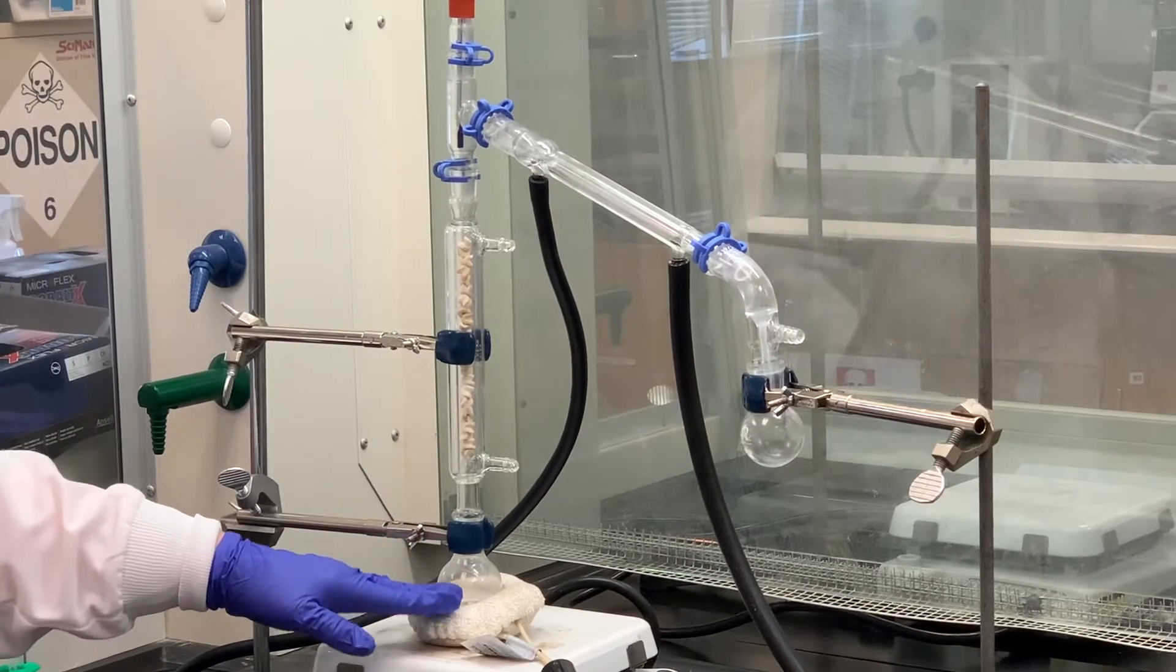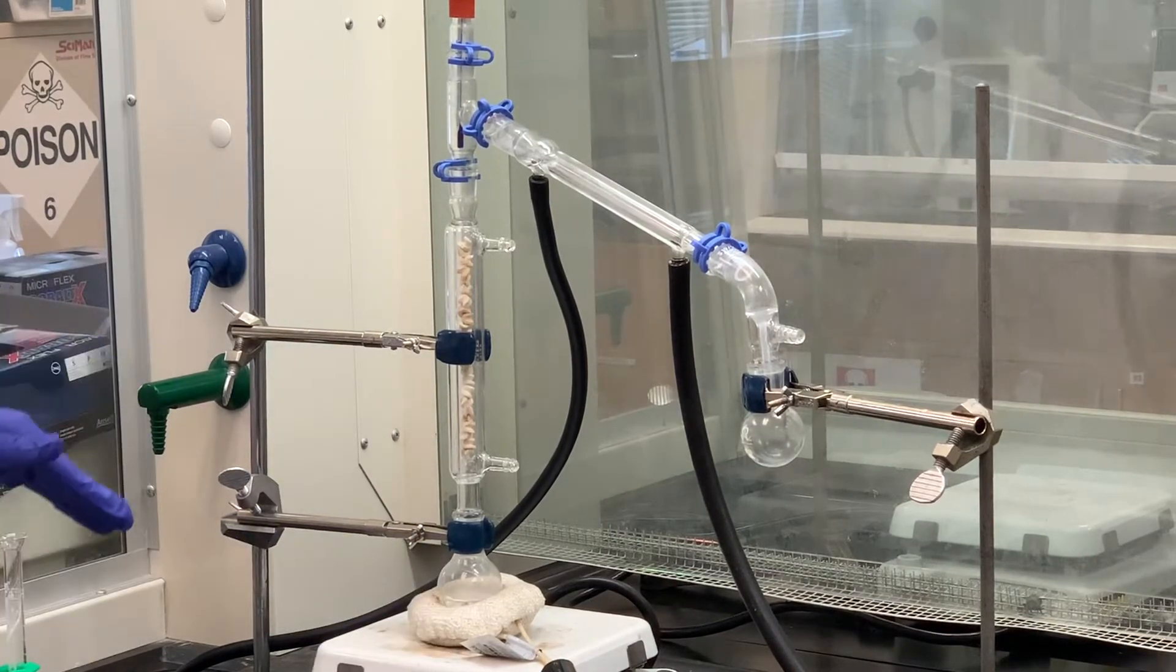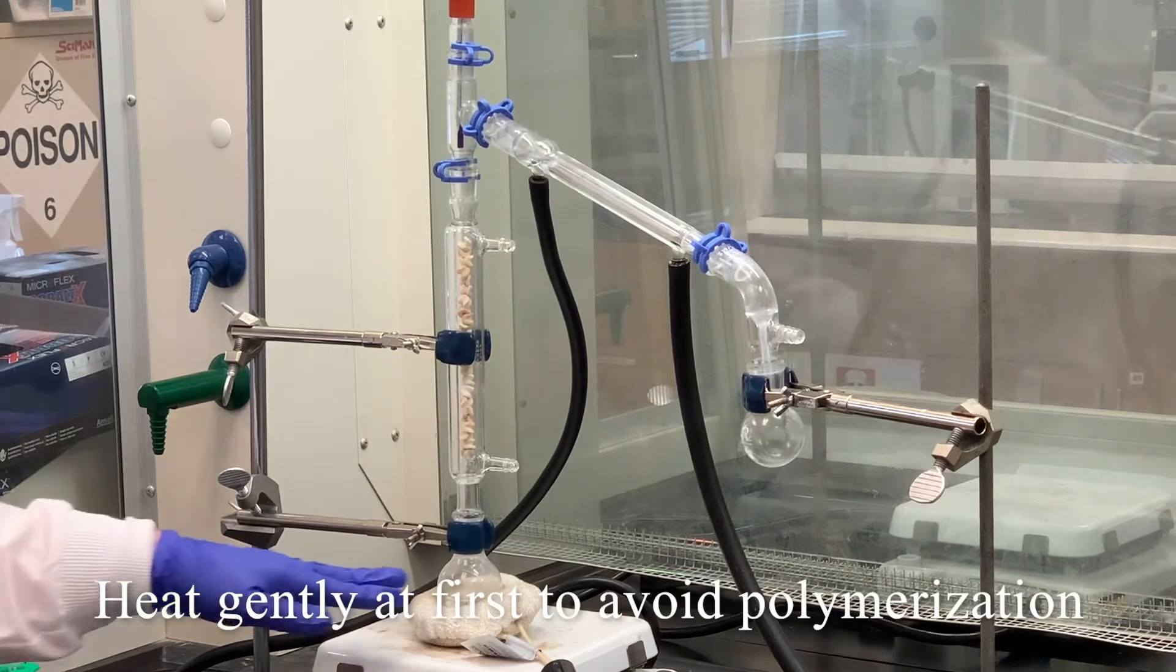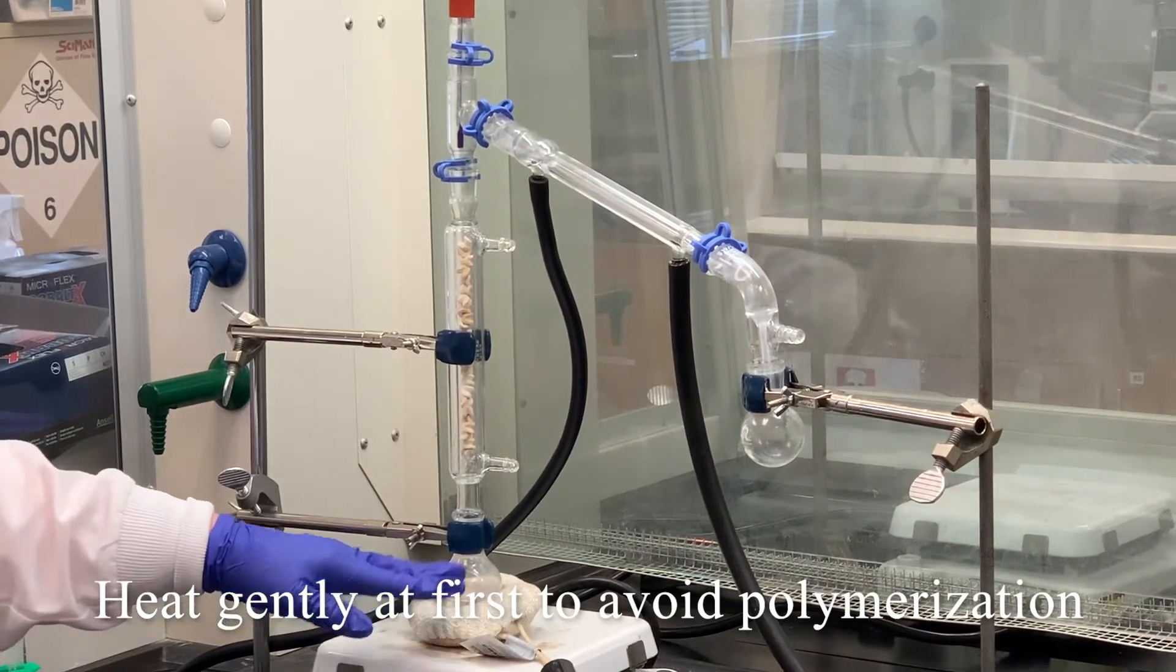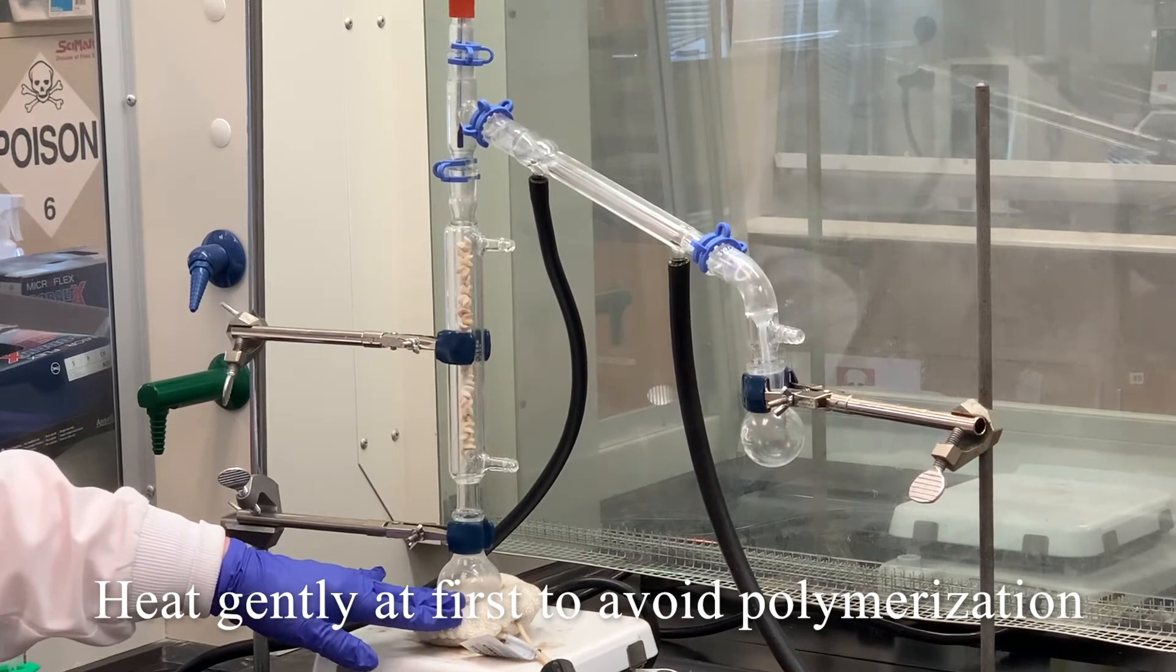But if you heat this too high, sometimes a polymerization reaction will happen and you end up with this black, tarry mass, if you will. So I'm going to start off maybe about medium-high heat.